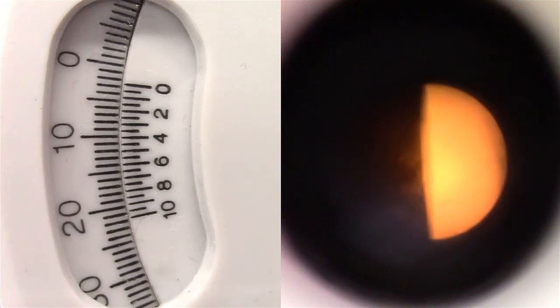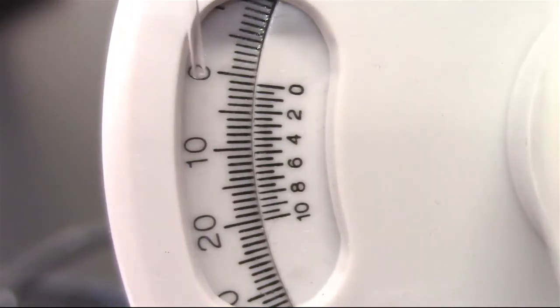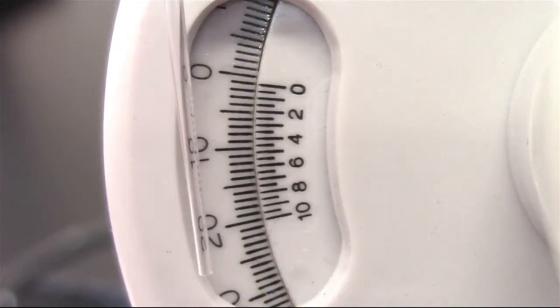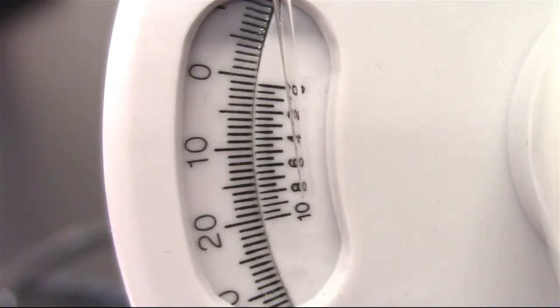You should observe a half dark circle on the left and a half dark circle on the right when you rotate the dial in opposite directions. Adjust the dial so that one full circle is seen. Now, you can read the observed degree of rotation using the numbers on the outer dials. The outer scale is the whole number for the observed rotation reading, and the inner scale is the decimal point for the observed rotation reading.